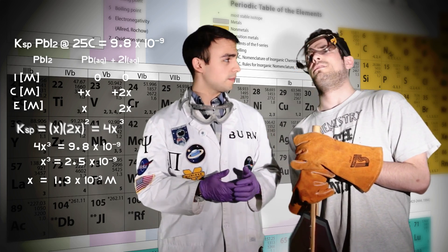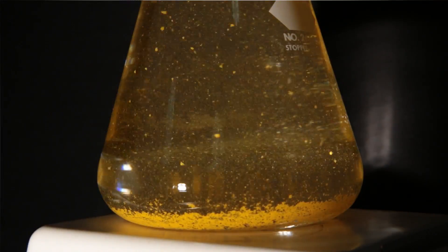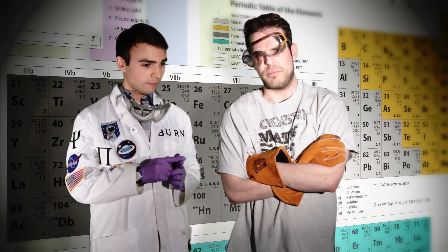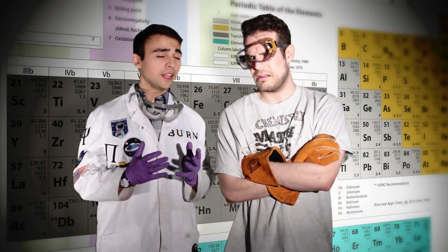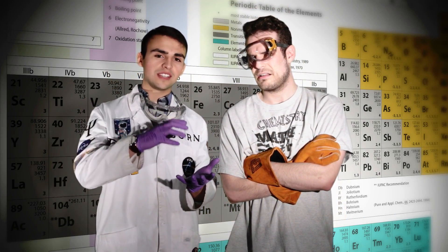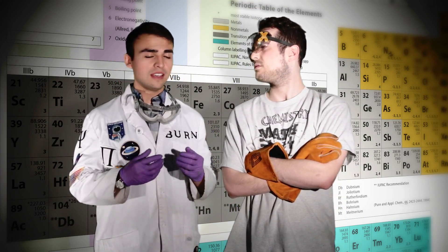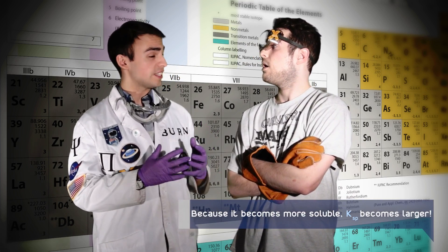Now, that's a very dilute solution, but it's a solution nonetheless. So you heated it up — right — and it's all hot, 100 degrees Celsius, and it's clear. Yep. Then you cool it back down, and all of a sudden there's these yellow snowflakes. What's that about? Solubility is actually dependent on temperature. Typically, if you increase heat to a system, the system will react to that heat, and a solid can become more soluble. In the case of lead(II) iodide, it becomes almost six times more soluble when at 100 degrees Celsius.